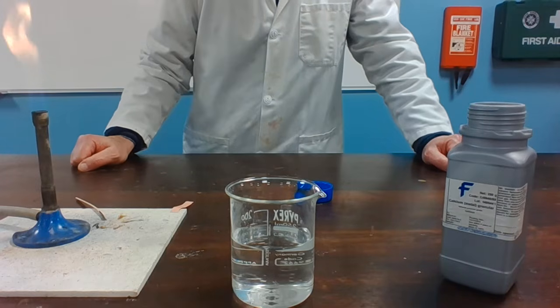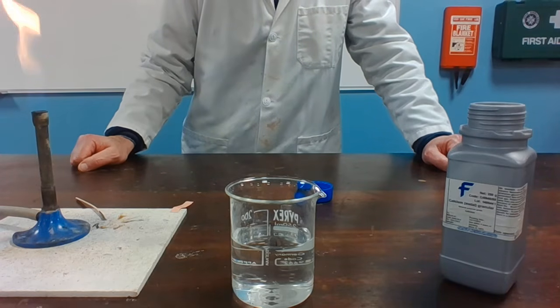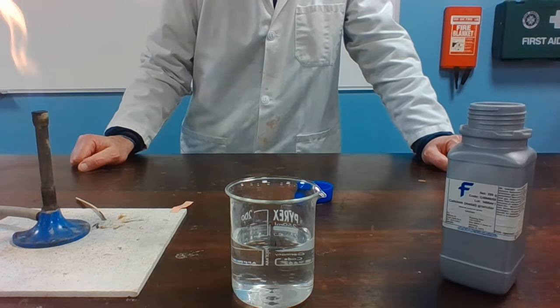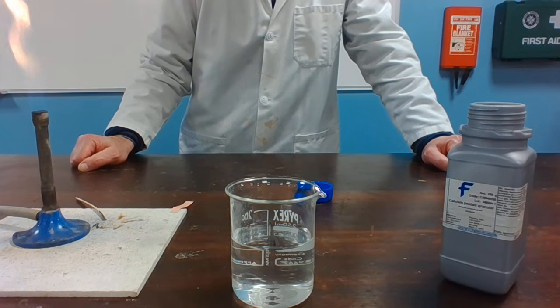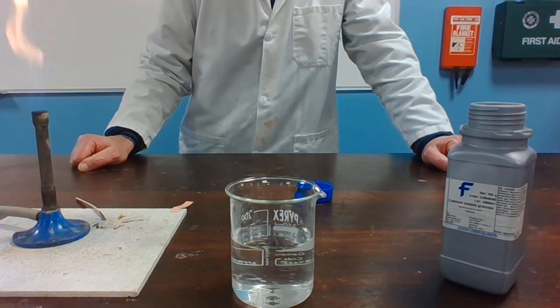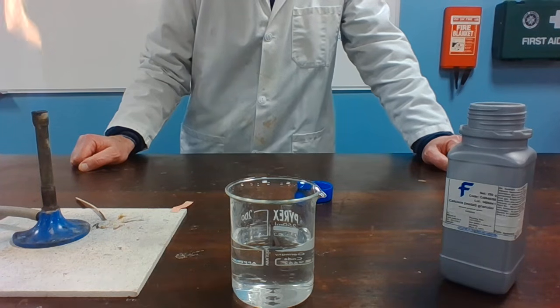This is a demonstration of calcium reacting with water. You may have already seen the reactions of sodium and potassium with water, which are quite violent. Calcium is a little bit further down the reactivity series and it is a silvery metal.